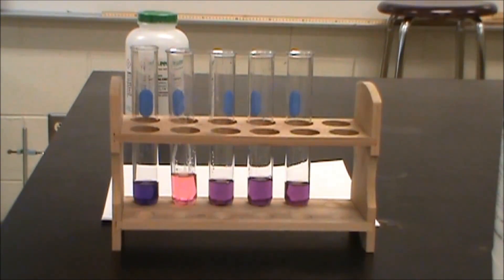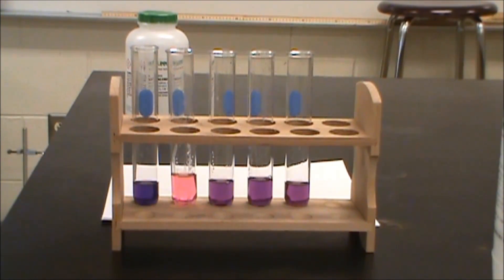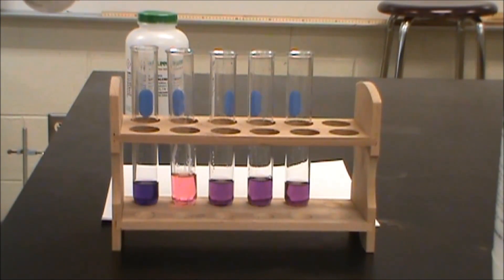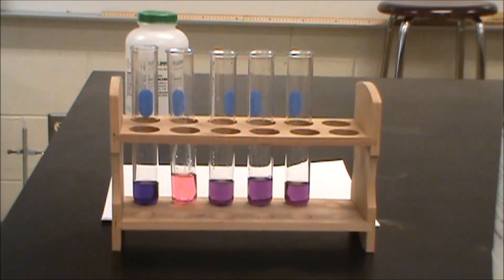In the third one we're going to add silver nitrate. Silver nitrate is expensive so we're just going to go with a little bit here. So we might not see a full great color change but we'll do our best. Silver nitrate should remove the chloride ions. So removing the chloride ions is going to cause the reactant concentration to go down, that's going to make Q go up. So we're going to shift to the left to replace those missing chloride ions and we're going to turn pink.